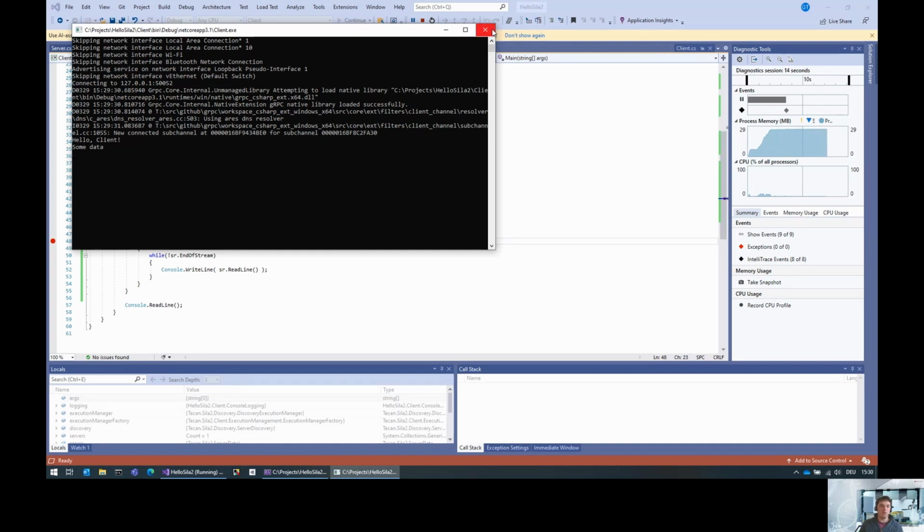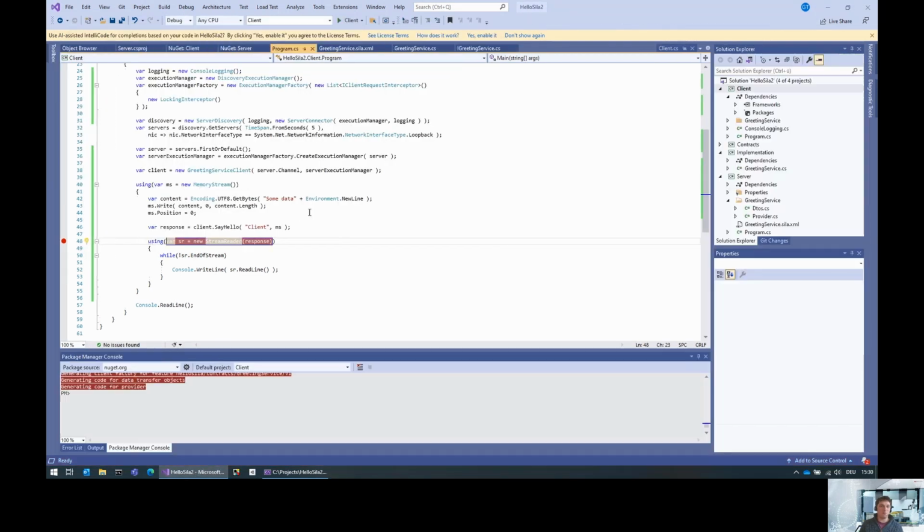But arguably, 27 bytes is not really representative of the amount of binaries that you want to transfer. But for such small binaries, what the SiLA 2 SDK is doing is putting that directly into the response message. So in that case, you don't have any binary storage identifier or anything like that. You just have the binary put inside the message according to the SiLA 2 standard.